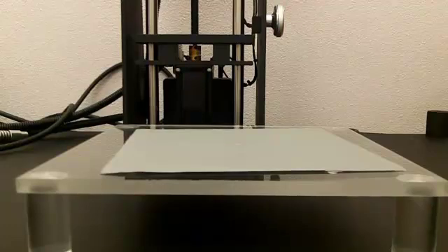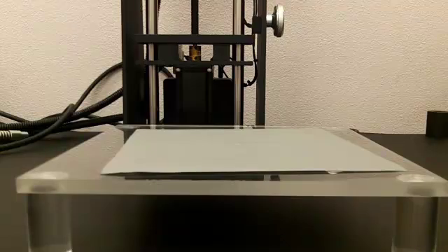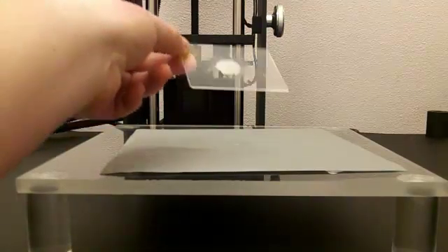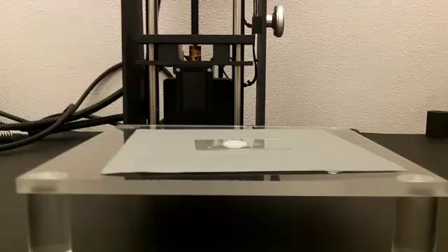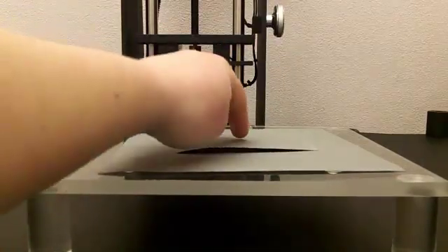I will go over how to prepare a dry-mounted specimen for a dorsal shot. First thing you need is a slide with a glob of wax on it and a grey piece of paper. You place the paper on top of the wax.